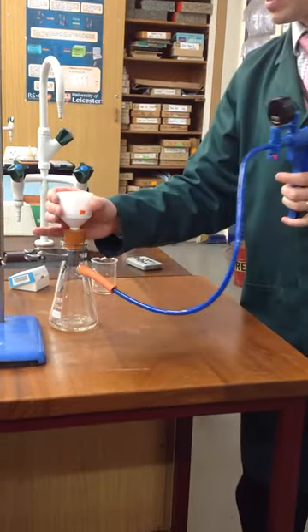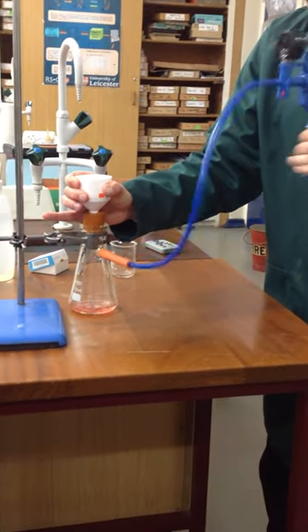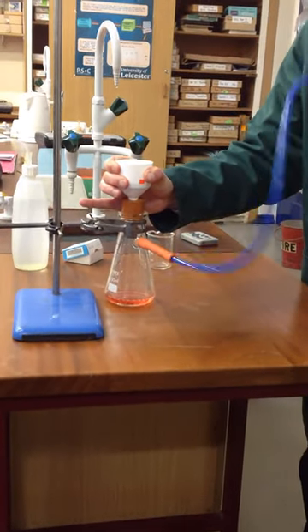And then you just apply a gentle downward pressure, and it will suck through. So if you come and have a look, you can see the top is completely dry.